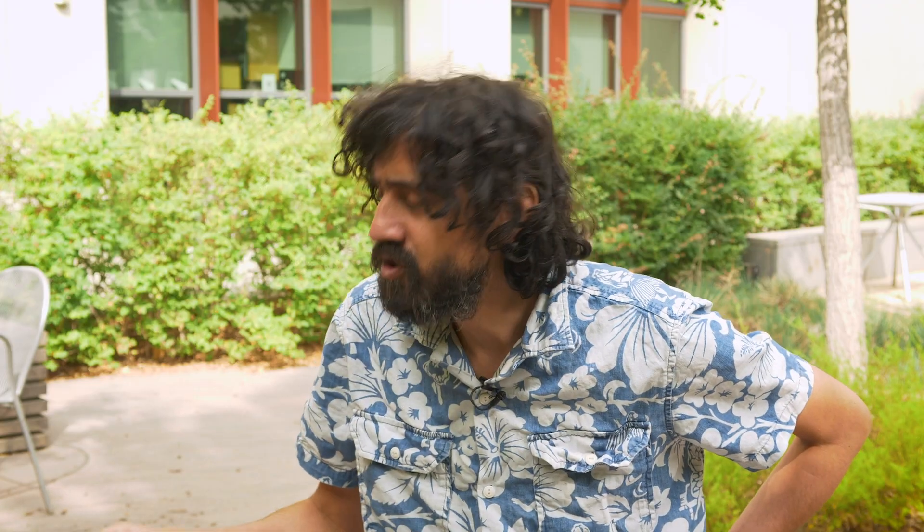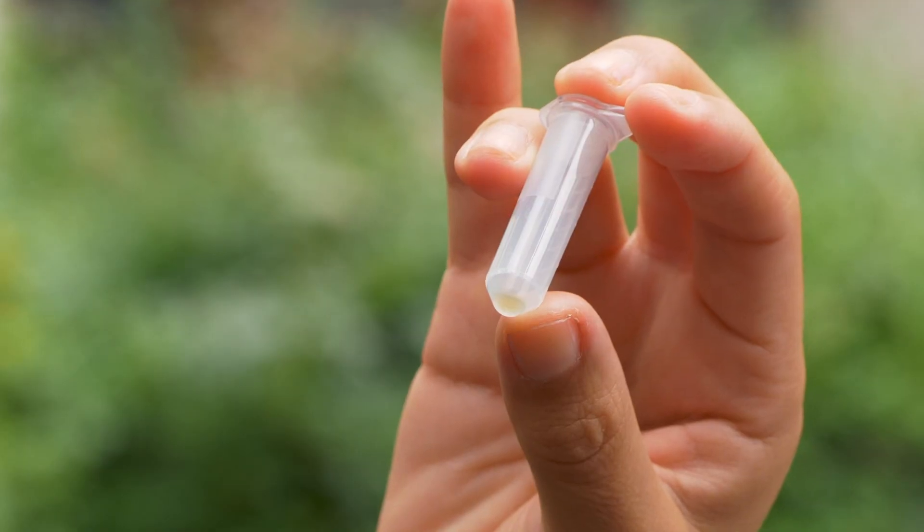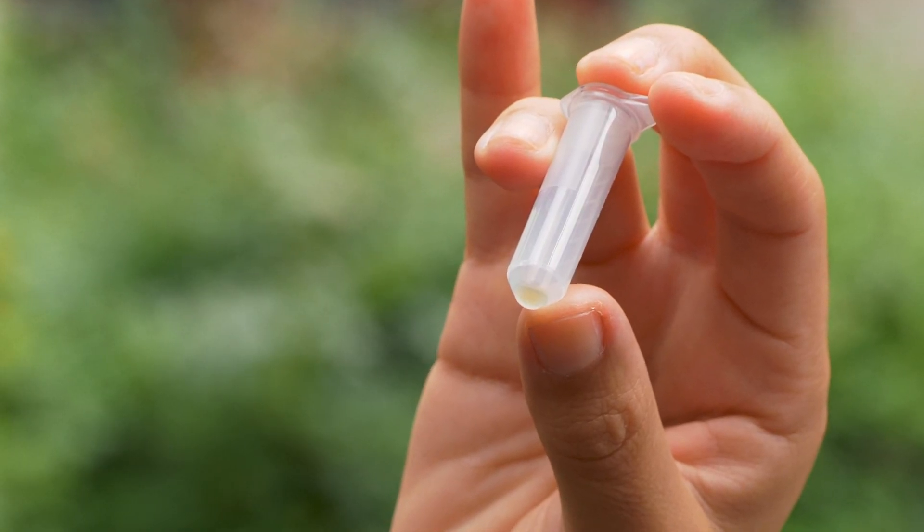What you just saw is a fairly straightforward protocol of the work we've been doing, especially building on other people's work in the scientific community. And one of the perspectives of this work is that the readout should be simple enough. So you were able to look at these tubes, and the change in that color tube literally tells you whether the test is positive or not. So you don't need any other gadgetry to be able to read these sets of tests.